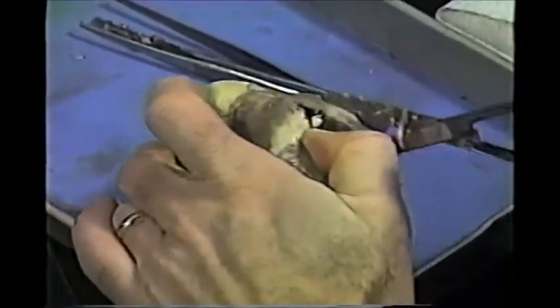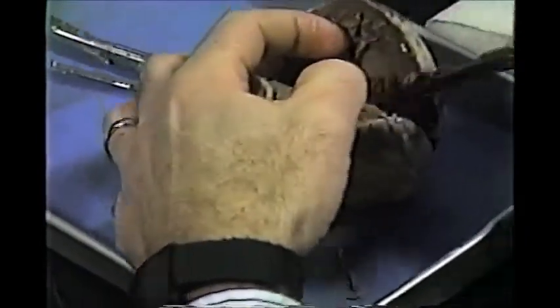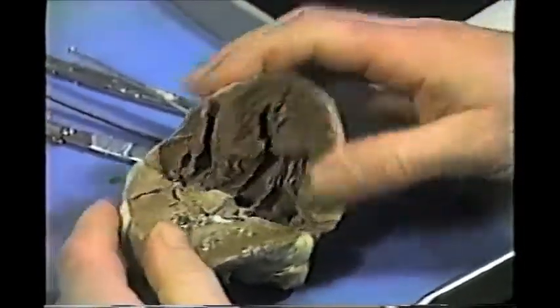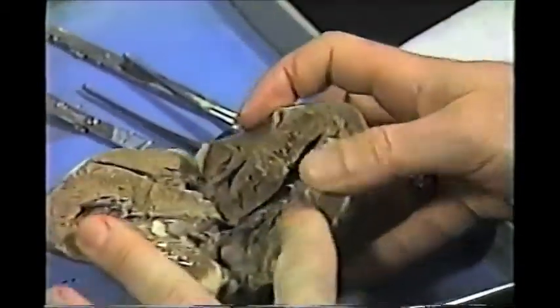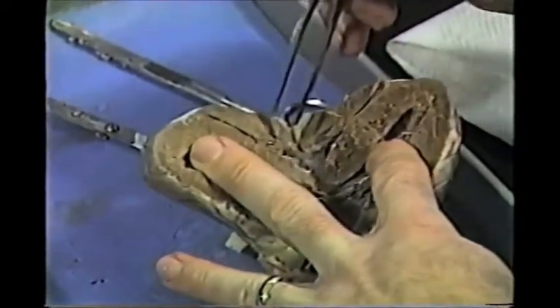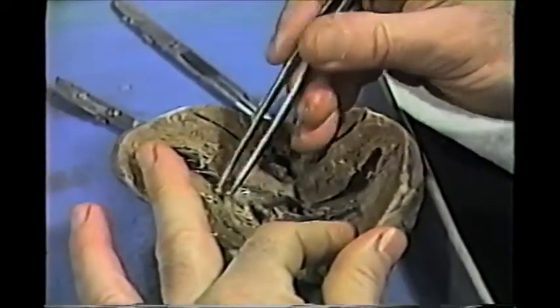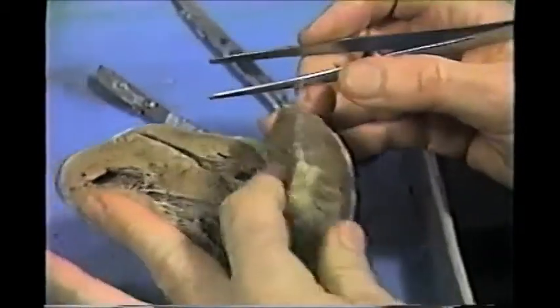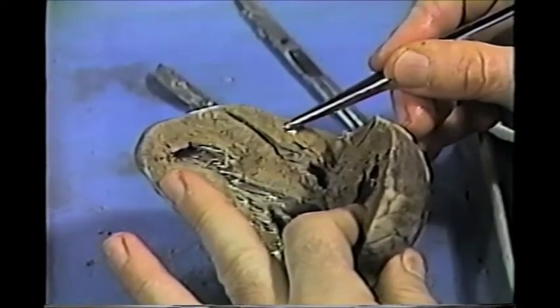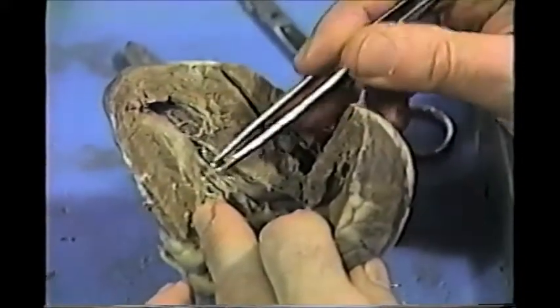This looks like one of those cooking shows — if you preheat the oven at 350. We're going to cut through the septum in between the two ventricles, so now it looks like the jaws of an alligator, and we can see the various parts. This is the lumen or the chamber of the right ventricle here, and this is the chamber of the left ventricle. You can tell right away which is right and which is left if you look at the thickness of the wall — the cardiac muscle, the myocardium of the right ventricle — it is much smaller than that of the left. The septum is what divides the two ventricles.